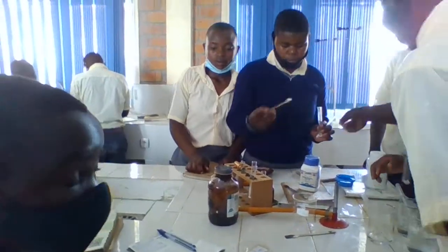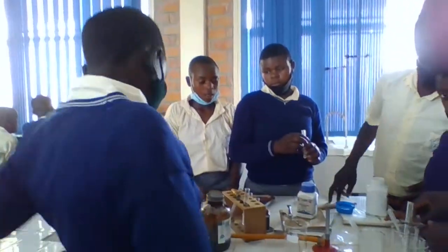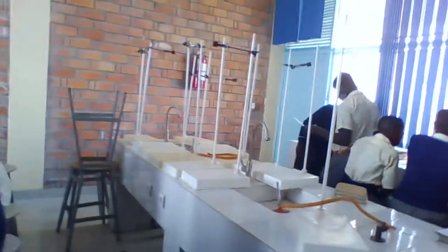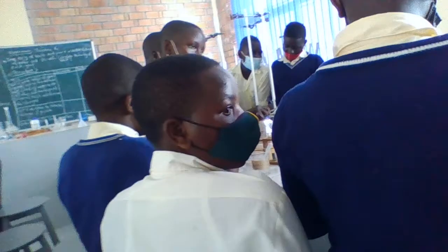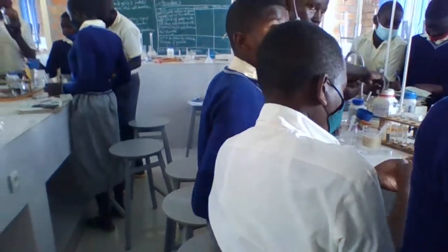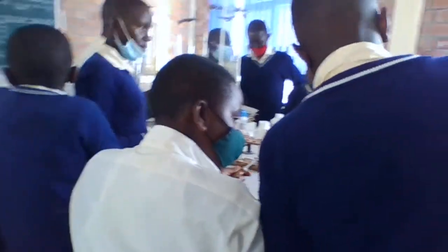Janet, how are you doing? Have you performed the experiment? Not yet. Okay. You have enough time. First of all, you have to close those reagents.